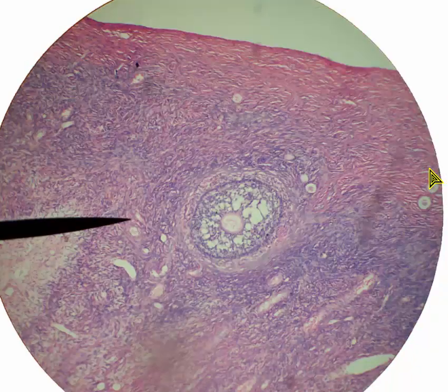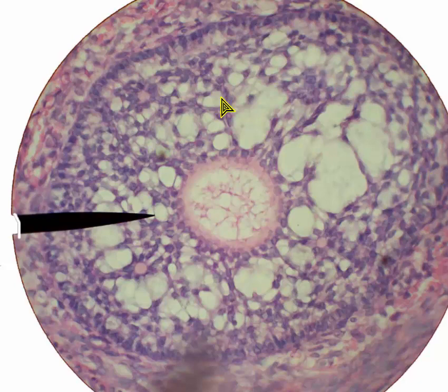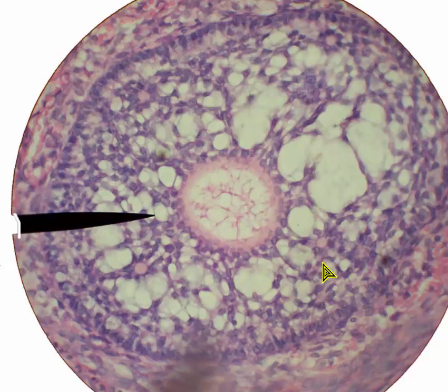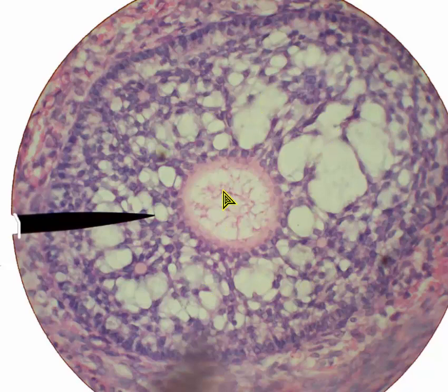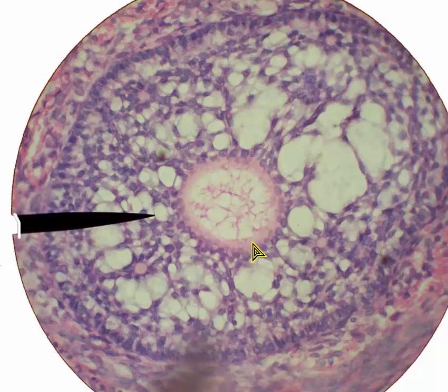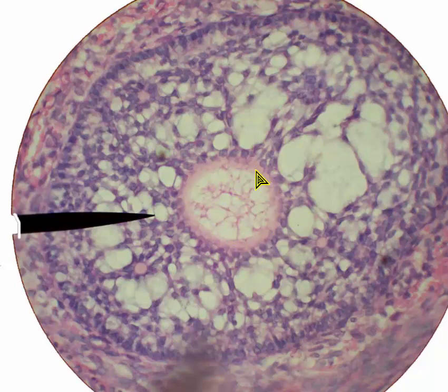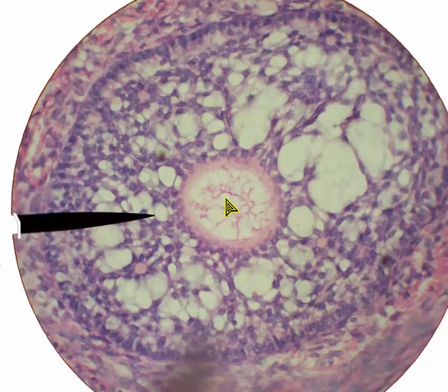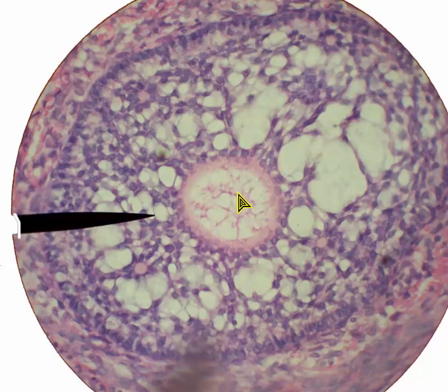Here's another image — that same follicle from the last image but at high magnification. The entire structure is the follicle. These cells around the oocyte are called follicular cells, and that's the oocyte. This outer covering of the oocyte is called zona pellucida. By the way, you can't see a nucleus here because the slice only caught a piece of the oocyte.